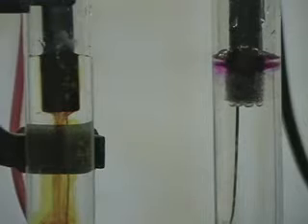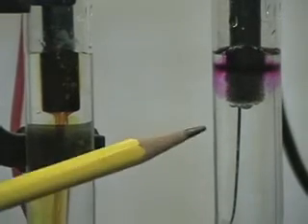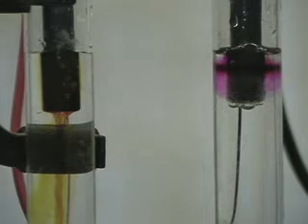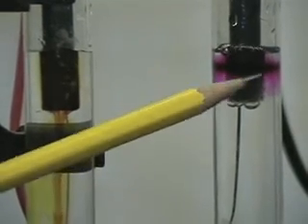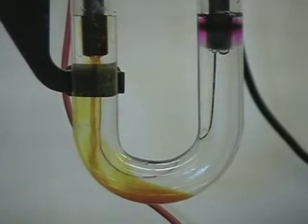Isn't science awesome? If somebody ever tells you that chemistry does not rock, you're definitely going to prove them wrong. Look at that — we've got a streaming river of iodine being produced, we've got hydrogen gas, we've got the OH⁻ ion being produced. This is the electrolysis of KI. Remember that it's not molten — it's the aqueous electrolysis of potassium iodide. And that's why we're producing iodine solid and hydrogen gas, which is a basic solution.